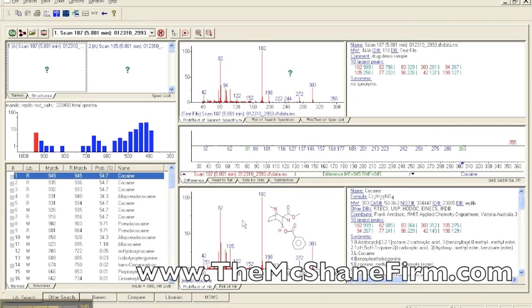Oh my goodness, it changes to cocaine with really high match factors and really high probability scores. And also over here we can see where it's compared. The probability score is not that great, I confess. And then the top three are cocaine.